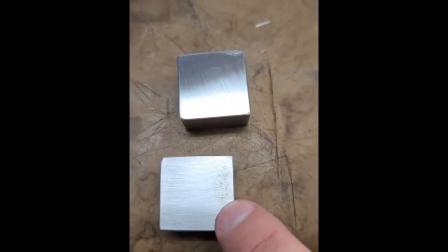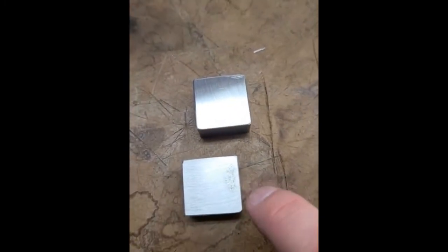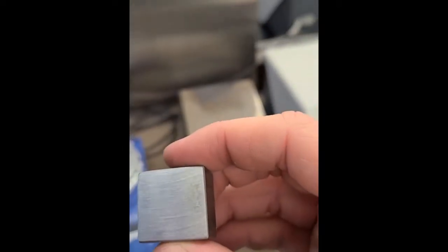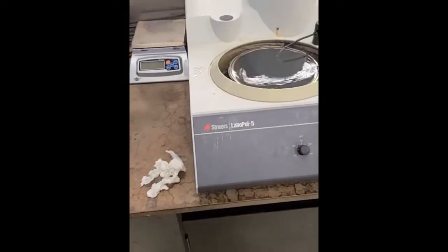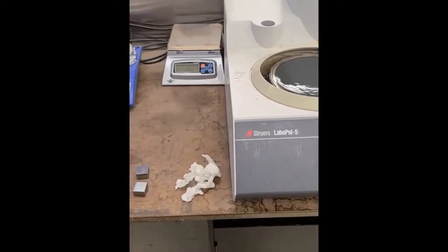And I just wanted to show you that even just with a little bit of water and leaving it out on the lab bench for a few minutes, that can start to be a problem. So we'll need to be careful when we're making these samples so that we make sure they stay clean, keep the water off the surface, but also make sure that we have this nice freshly polished surface to remove any oxides before we do any hardness measurements or etching of the surface.